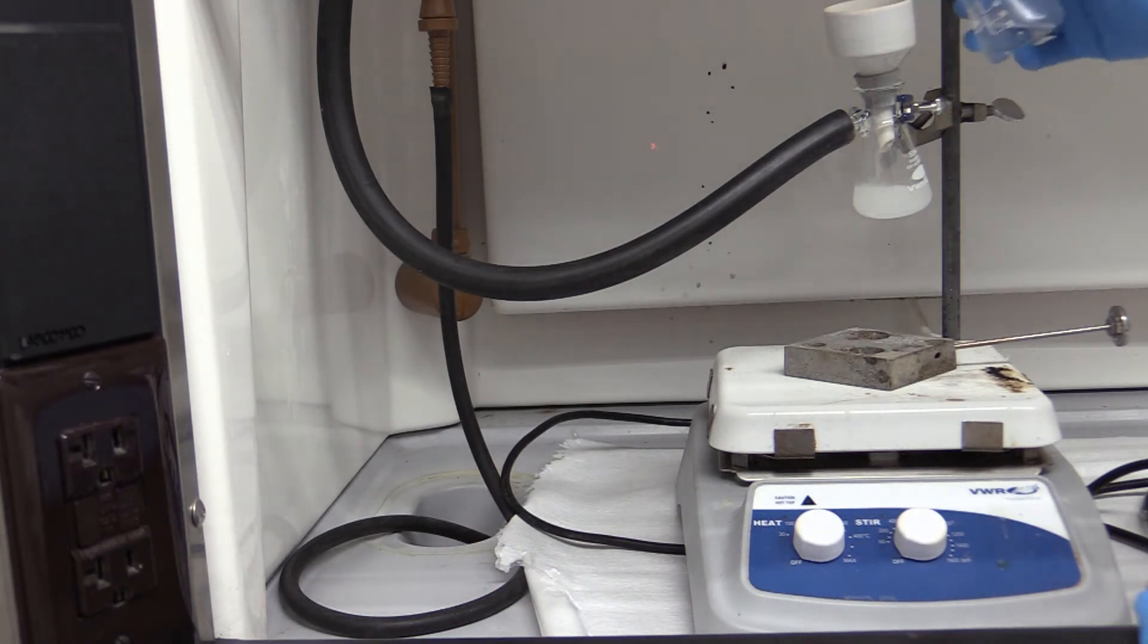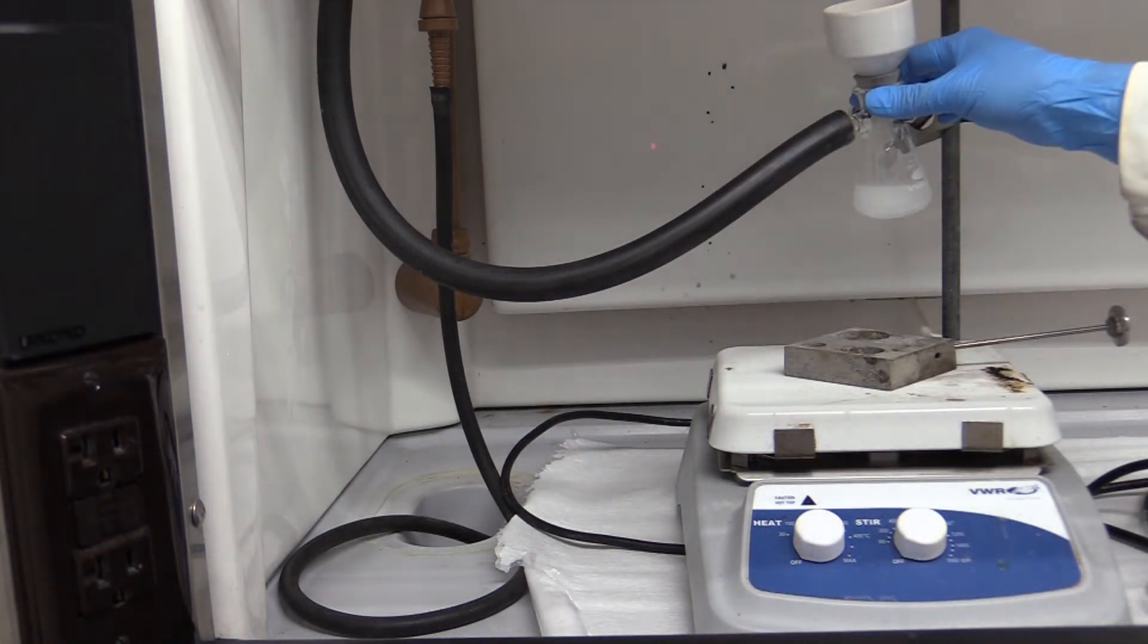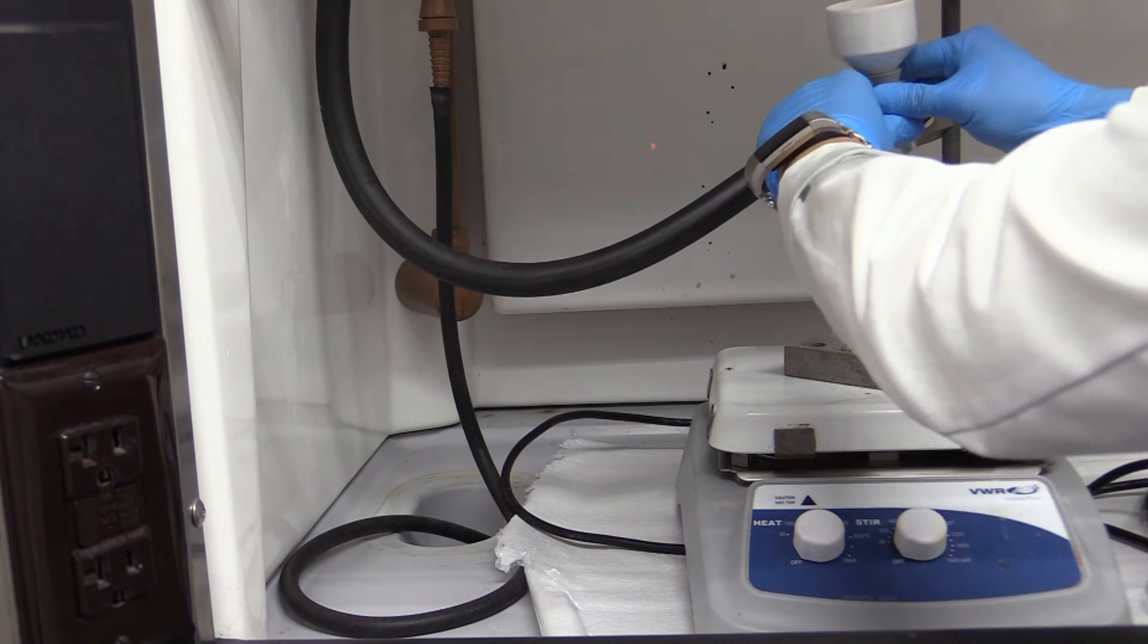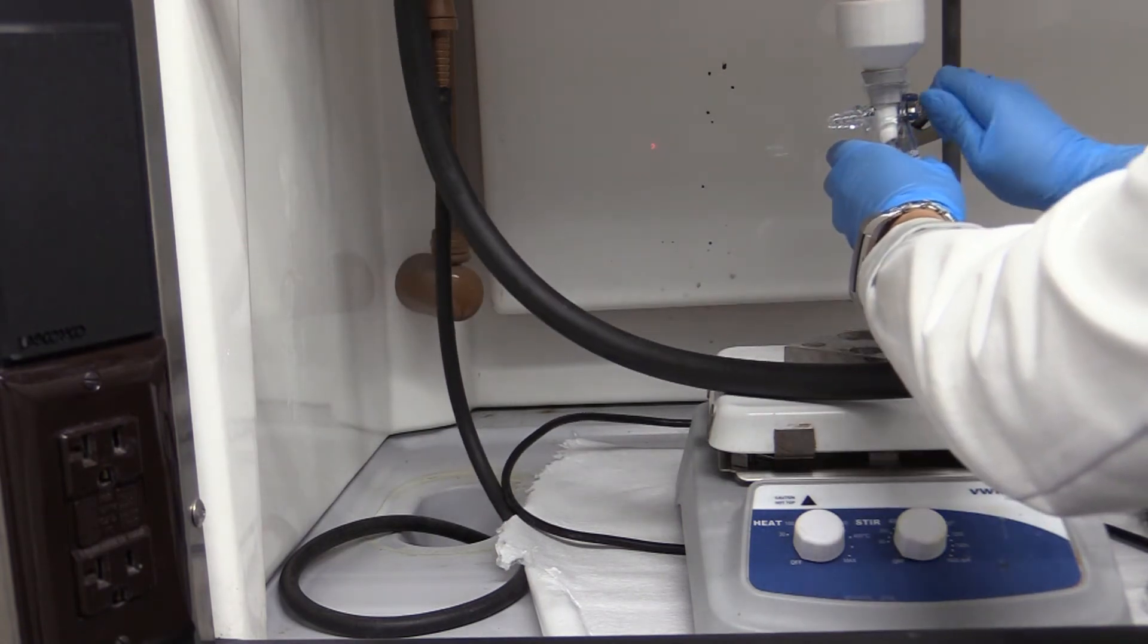Rinse the crystals in the filter with more cold solvent. When no more liquid drips out of the bottom, turn off the vacuum. Remove the hose. Take off the filter and admire your work.